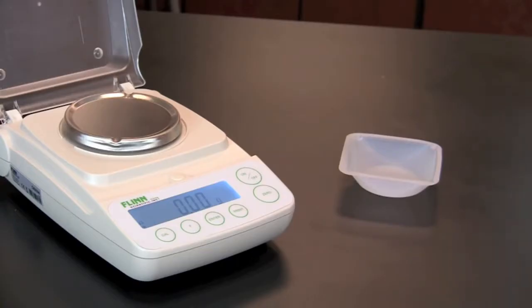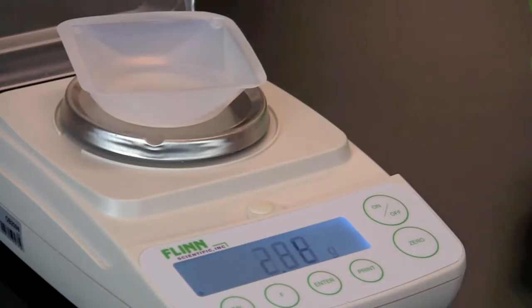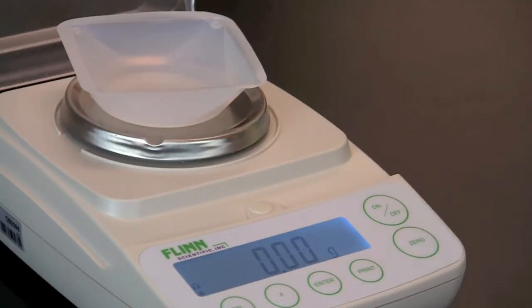Next, place a clean weigh boat on the balance. When the reading has steadied, set the balance to zero with the weigh boat.